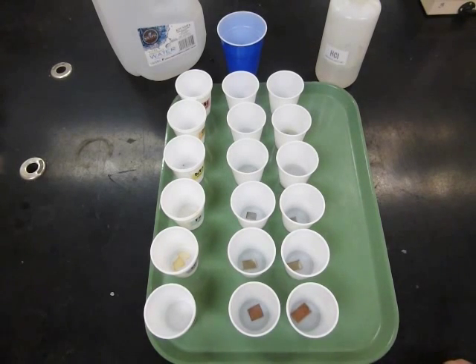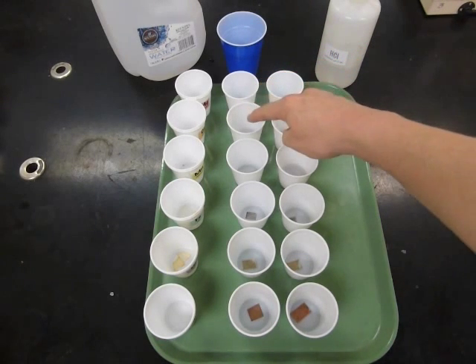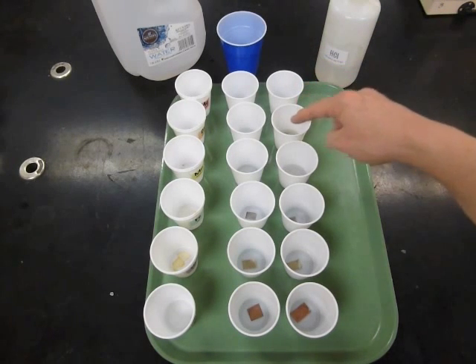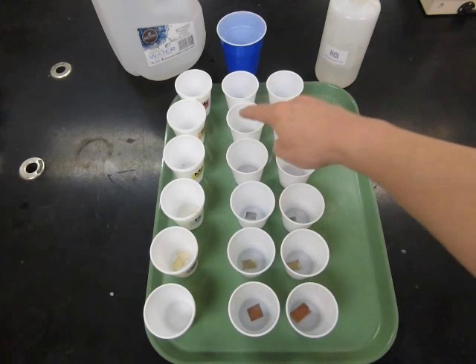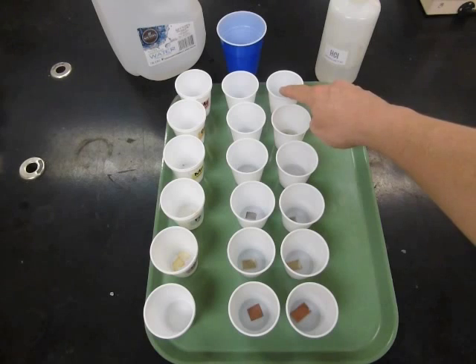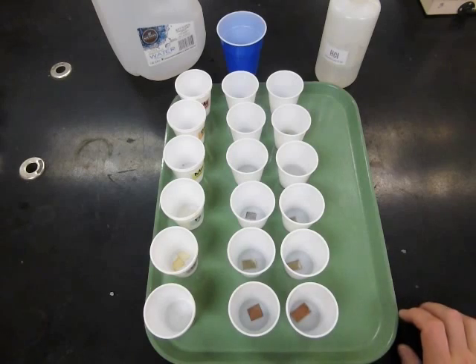Between the three, manganese is the least reactive, magnesium is more reactive, and calcium was the most reactive with water. So those are the results for the reactions of water with magnesium, calcium, and manganese, and hydrochloric acid with magnesium, calcium, and manganese. Calcium was the most reactive of the three, magnesium was the next most reactive, and manganese was the least reactive of those three elements.